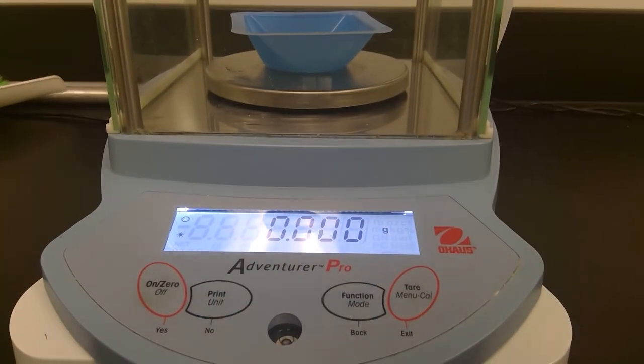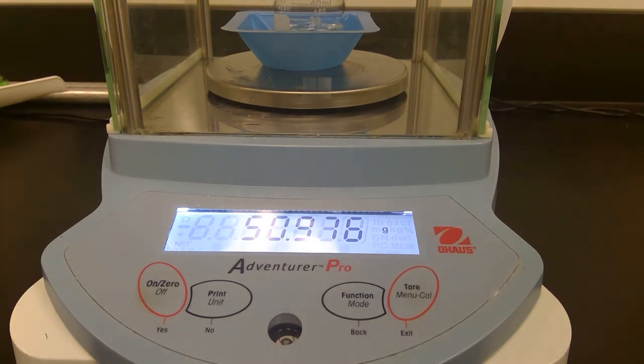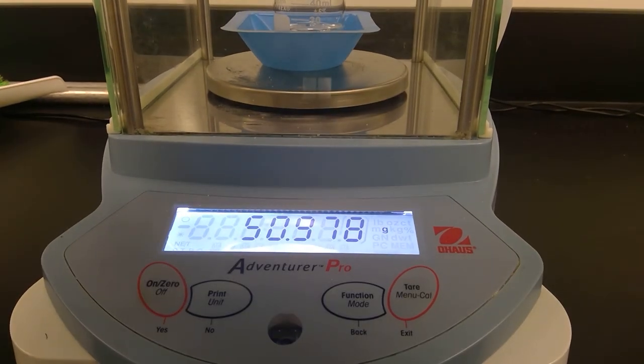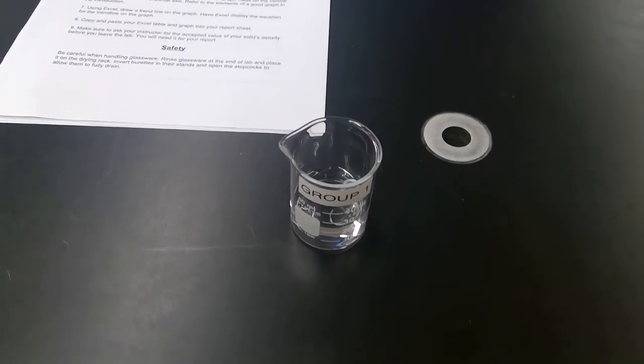Now we will do the final weight of our beaker with the water in it. It's stable, so record the mass of your beaker with the water in it.